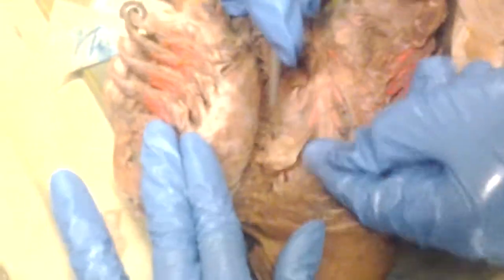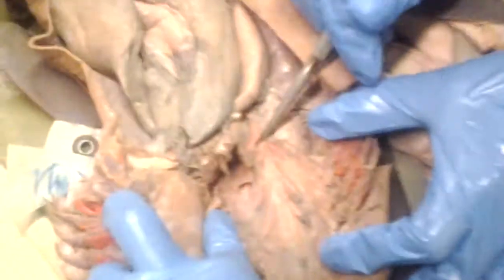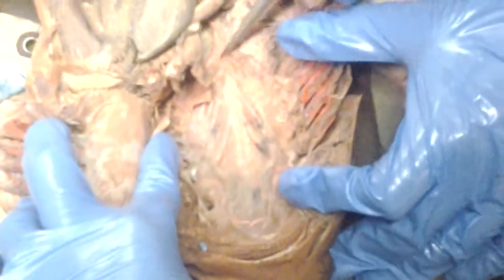All right. So, what is this thing hanging? That's a good question. It's just some connective tissue. Okay, no problem. Now, what's this? Here's a good question. Aorta? What is all this here? Dorsal aorta. Dorsal aorta, right.